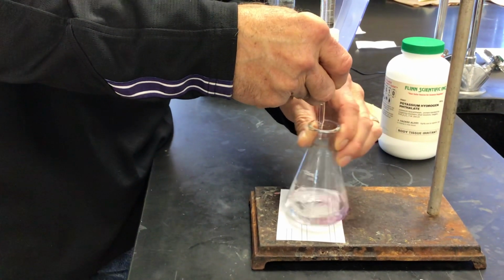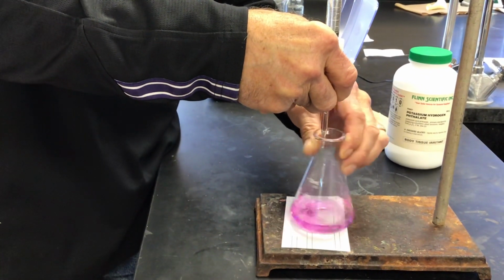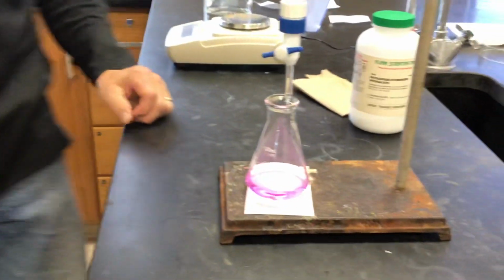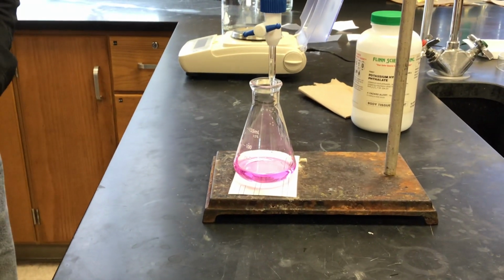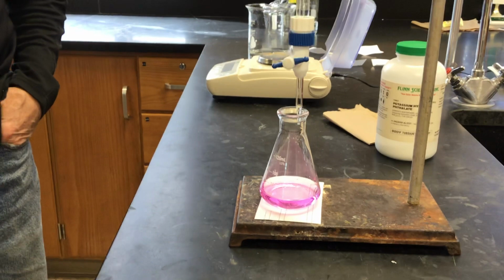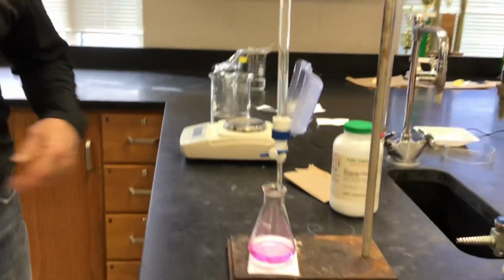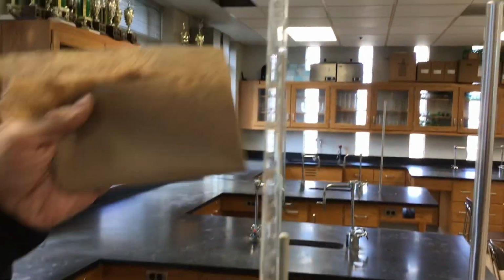You see the pink show up, and then it goes away. We swirl it away. We still have an excess of acid, but no longer. Phenolphthalein is pink when it's in a base, and so we have just taken this KHP acid and made it a basic solution with an excess of sodium hydroxide. I wasn't being very careful, so I know I went past the end point. But now we have a ballpark idea of how much base it takes.